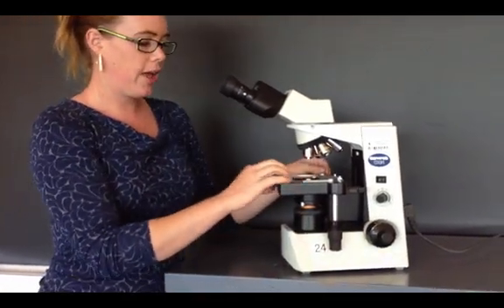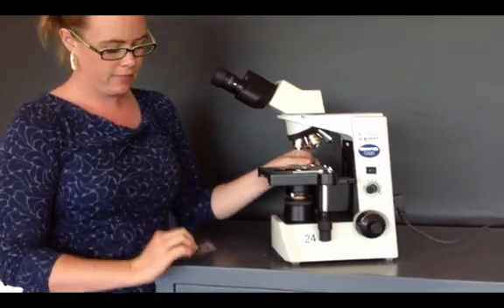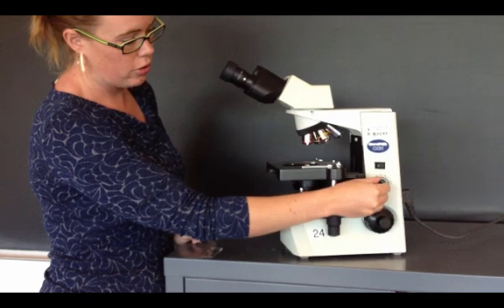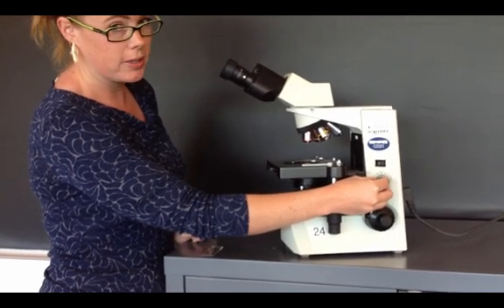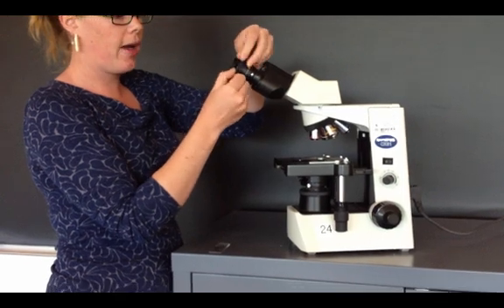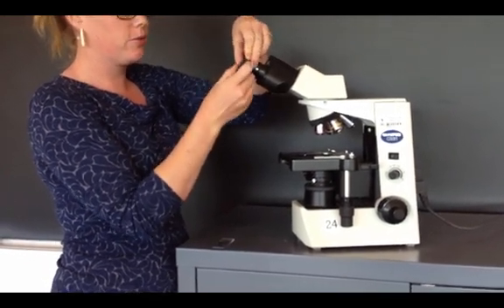Gently remove your slide, and make sure the rheostat is turned all the way down to the lowest setting. You can also flip back the eye protectors if you use them.